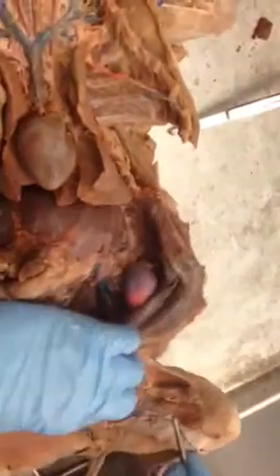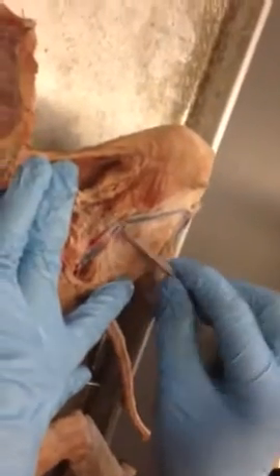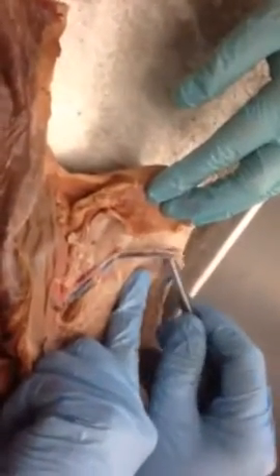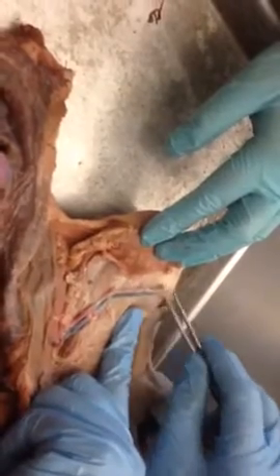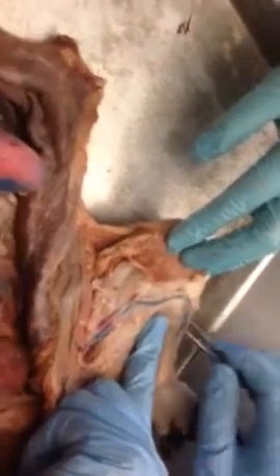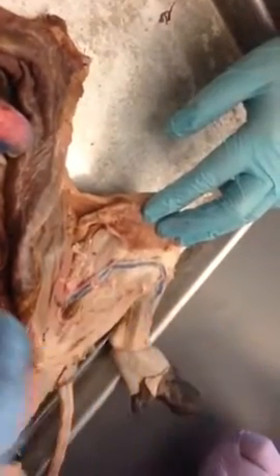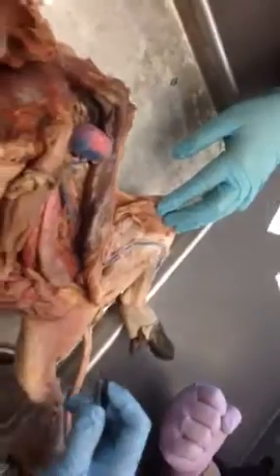Now this is where we're gonna have to clean up a little bit more next week, but we're almost there. So this is femoral. Now the femoral right here, it kind of ends, it dives down in, and then this continues on. See how superficial this is? It's right underneath the skin. There's nothing holding it there anymore because it's really the skin that kind of holds it down, and that's the great saphenous vein. Say it again. Great saphenous.